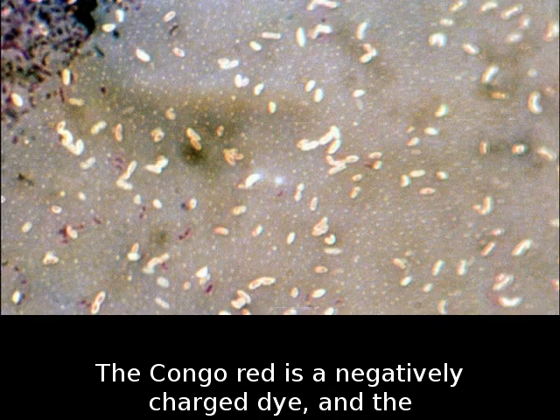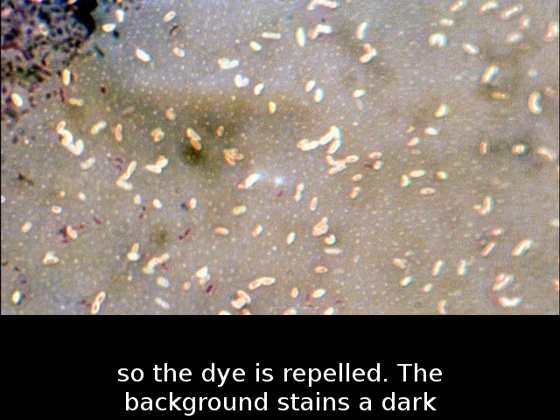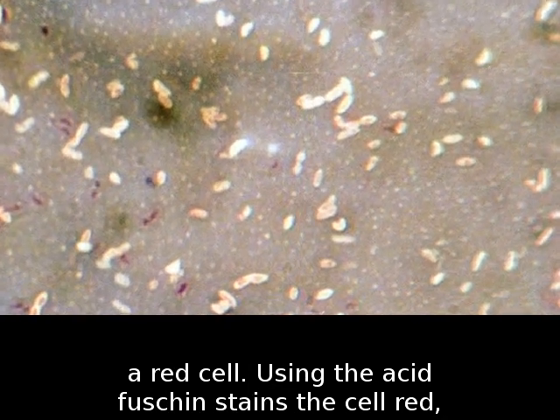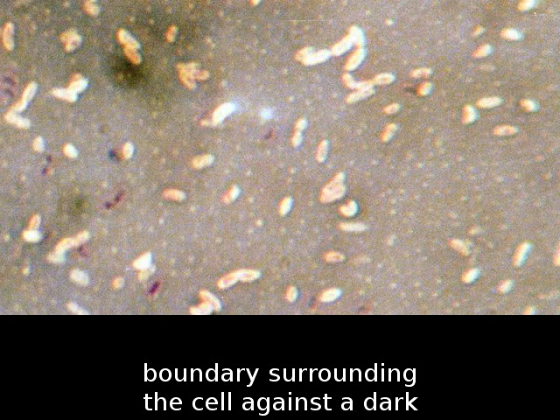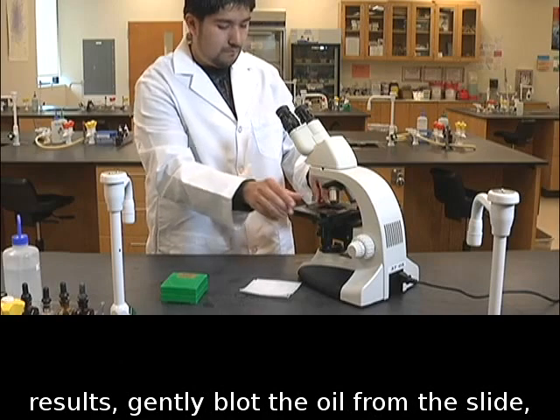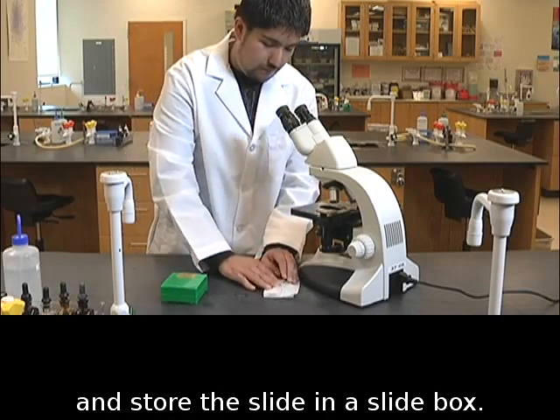The Congo red is a negatively charged dye, and the bacterial surface is also negatively charged, so the dye is repelled. The background stains a dark color, and capsules will be visible as a white halo around a red cell. Using the acid fuchsin stains the cell red, but not the capsule. The capsule remains as a clear boundary surrounding the cell against a dark background. When you have finished viewing your results, gently blot the oil from the slide and store the slide in a slide box.